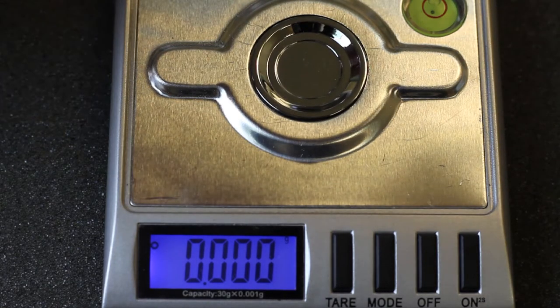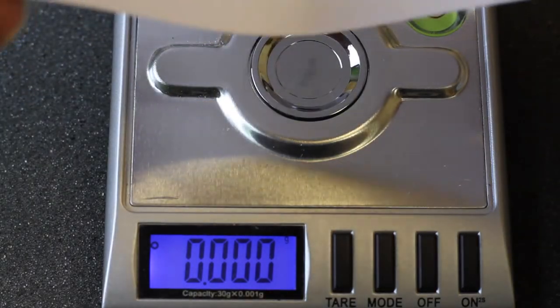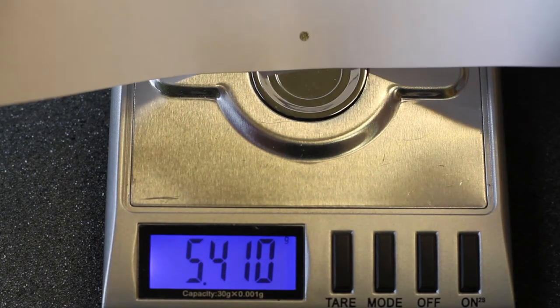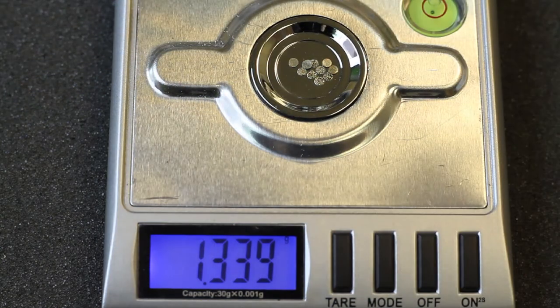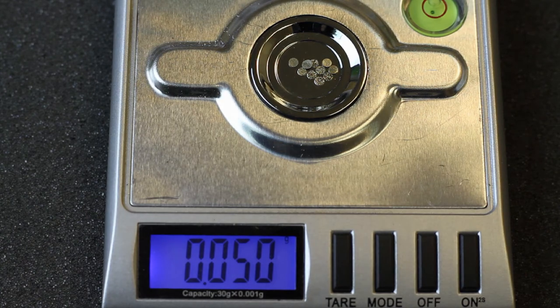We're going to measure the weight of 10 of the used fuel elements. These are the micrometric diamonds embedded in nickel from the 3M diapad that was baked for a week at 200 degrees C and dunked in deuterium oxide. That's about 5 one-thousandths of a gram for one fuel element.